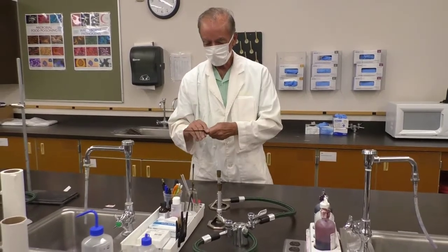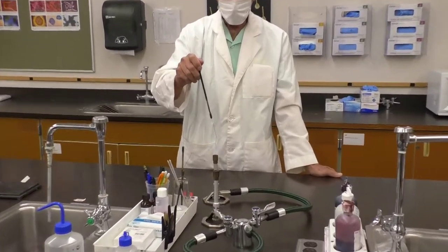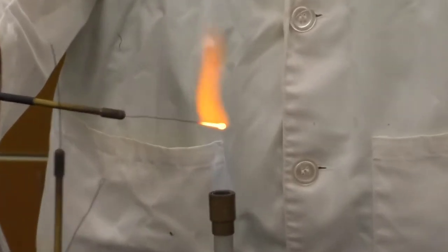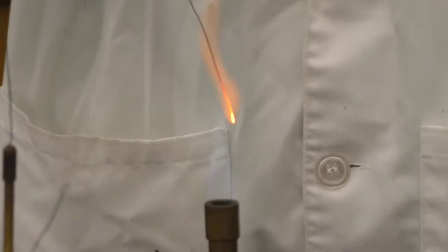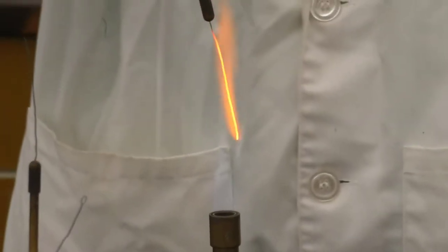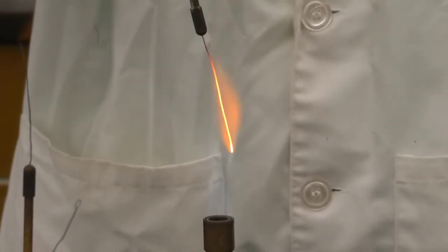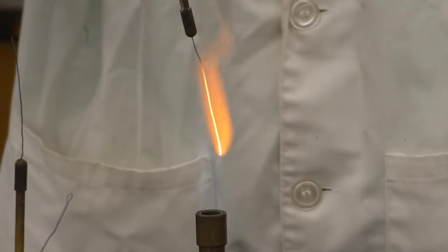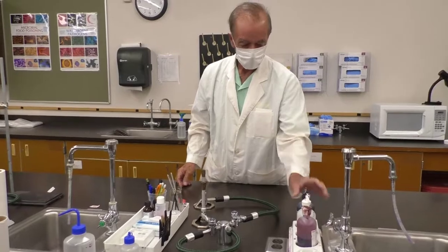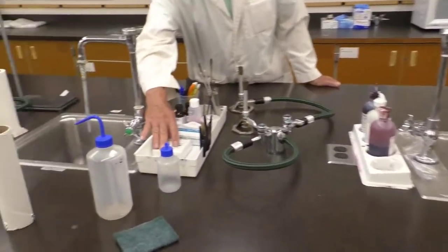You will see people use different techniques, but in some of the videos, you will see people sterilize the inoculating loop like this. I discourage people from using this technique. The reason the inoculating loop has a long handle is you can sterilize it like so. And you'll see in Tim's demonstration, in one of the videos, the correct use for sterilization of the inoculating loop. Inoculating loop. Stains for staining bacteria, marking pencils, slides.